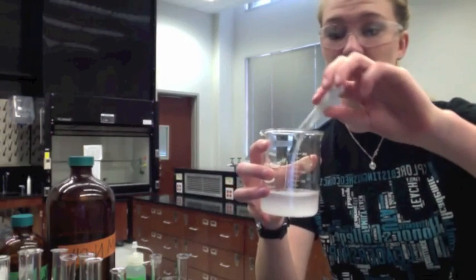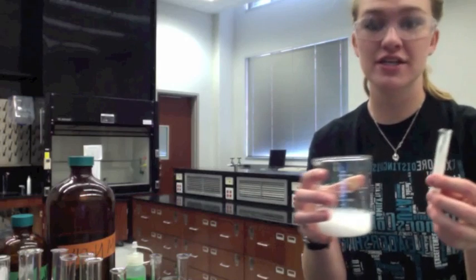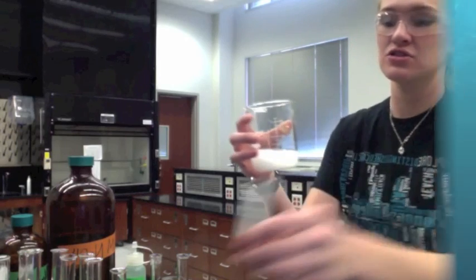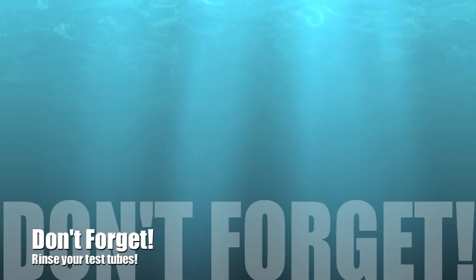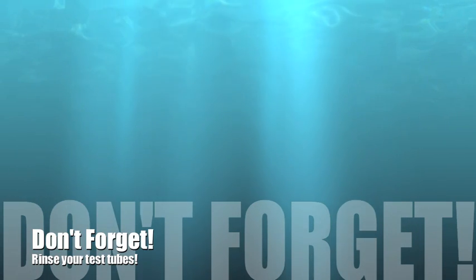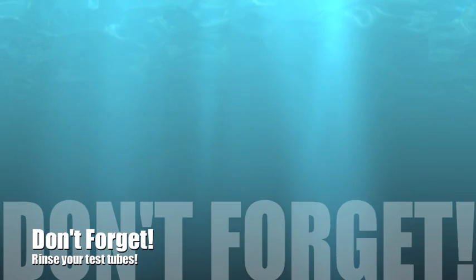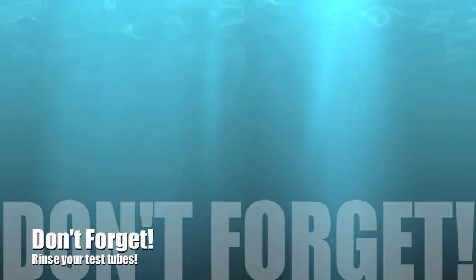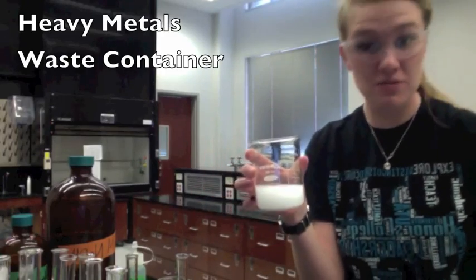In this lab, you will collect all of your wastes in a 400 mL beaker. The wastes include solids in your test tube and the used test solutions. After dumping out your solutions into the 400 mL waste beaker, rinse each test tube with a small amount of deionized water and pour it into the waste beaker. After collecting all of your wastes, be sure to dispose of it into the heavy metals waste container.